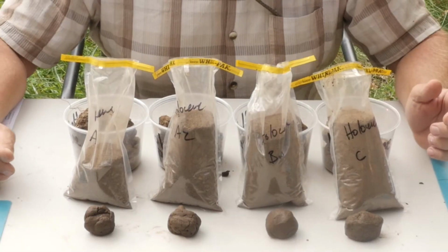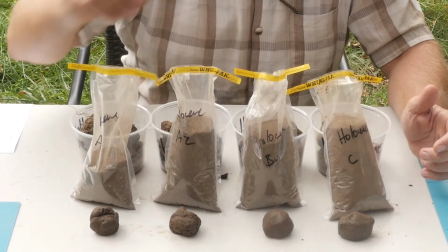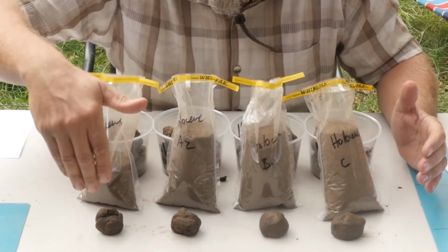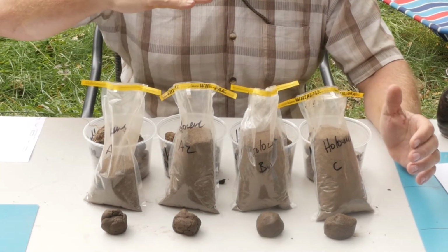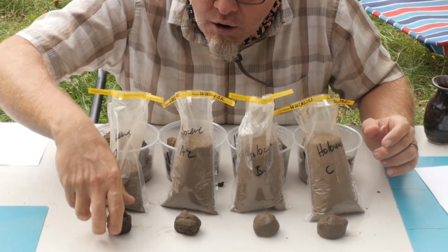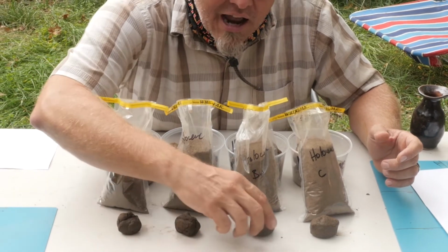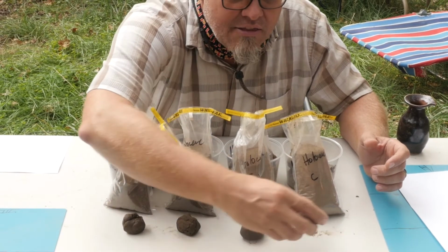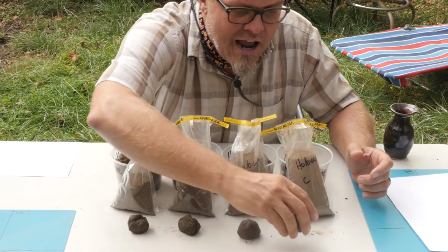All right, so we took a moment and worked up these 4 texture balls from our surface down through the profile. Once again, just wetting these samples up, you can really see the contrast in color, but then you also realize that wet soils often can also mask some of that color. It can make everything darker. You can see here a really nice dark surface soil down into that second horizon. Then you start to lose some of that organic matter and some of that darkness, and then down into the primary parent material in the C horizon.